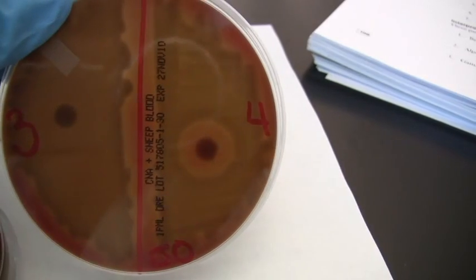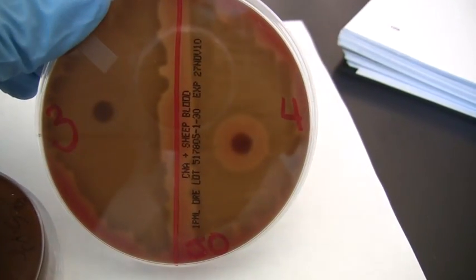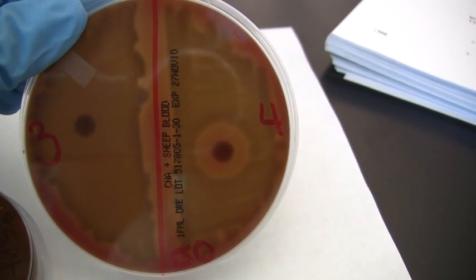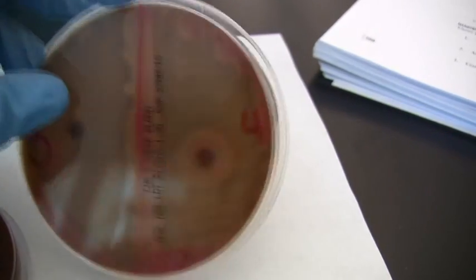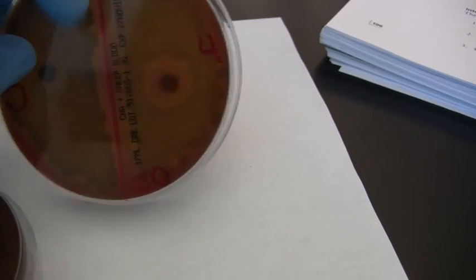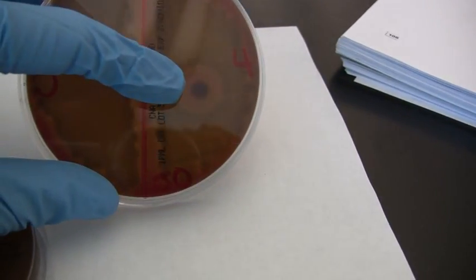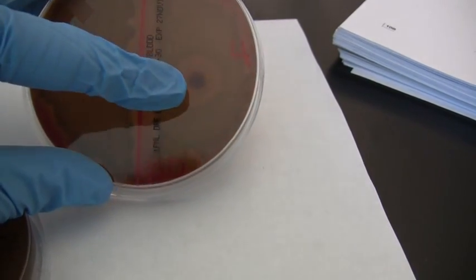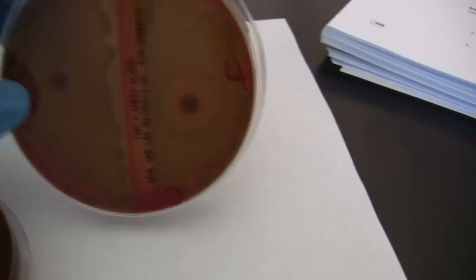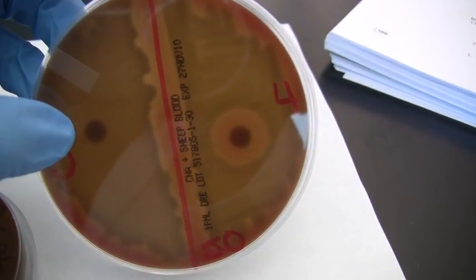What we do see is a difference in the optochin antibiotic disc result, or what we call the P disc. Again, we're looking for a clearing zone if the organism is sensitive. So here on the right, we have at least a dime-sized clearing, somewhere around 10 millimeters in diameter, that indicates the organism is sensitive to this antibiotic, so it can't grow up all the way to the disc because it's sensitive to it and it's prevented from growing. This organism here on the left, however, is resistant to the P disc and can grow all the way up.